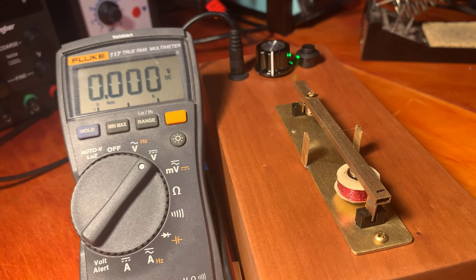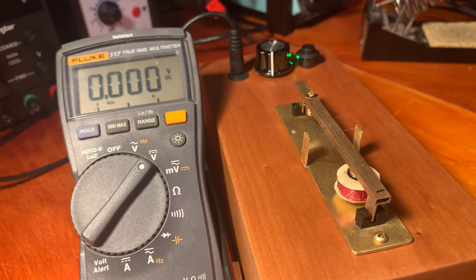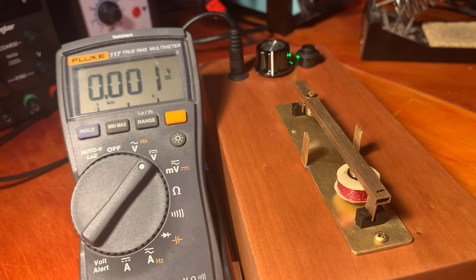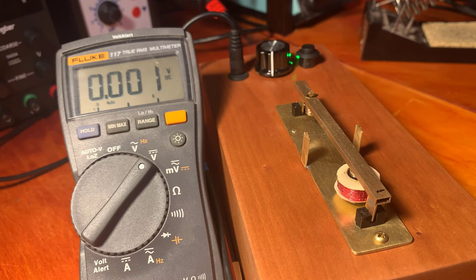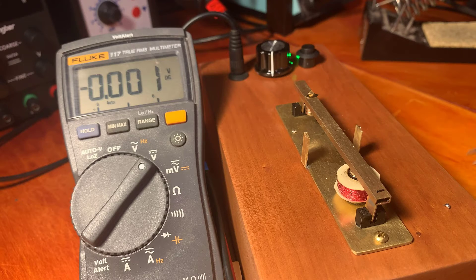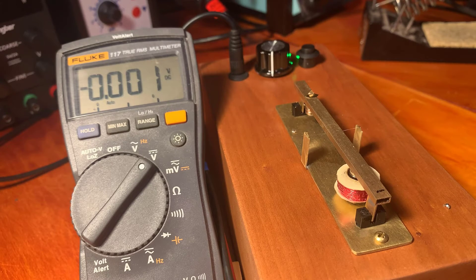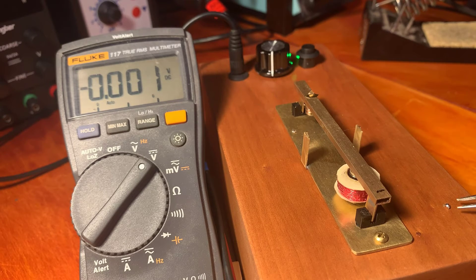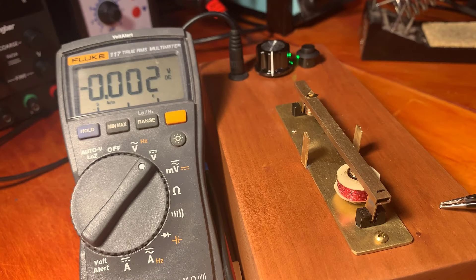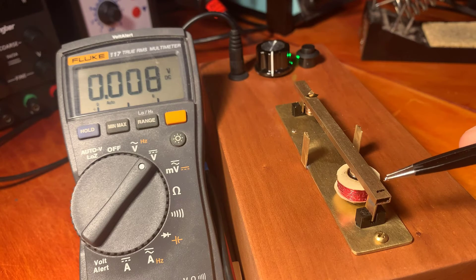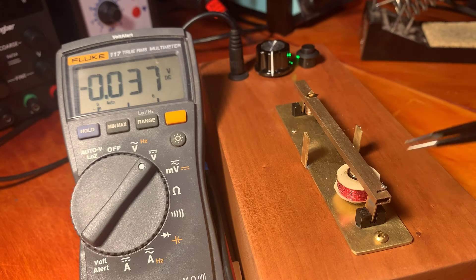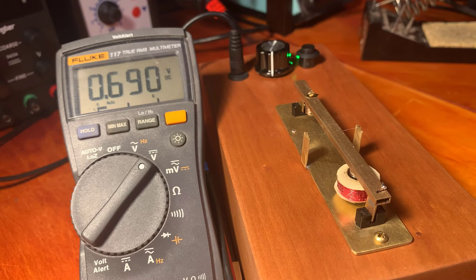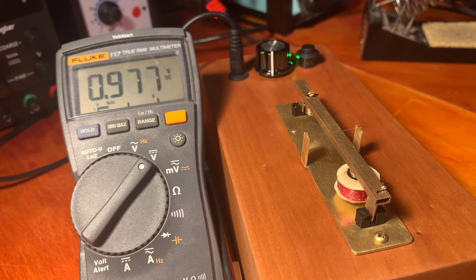So let me weigh something substantial here. So I've got this piece of solder, a ball of solder, and I'll put it on there. And that's a huge weight for this balance, of course.